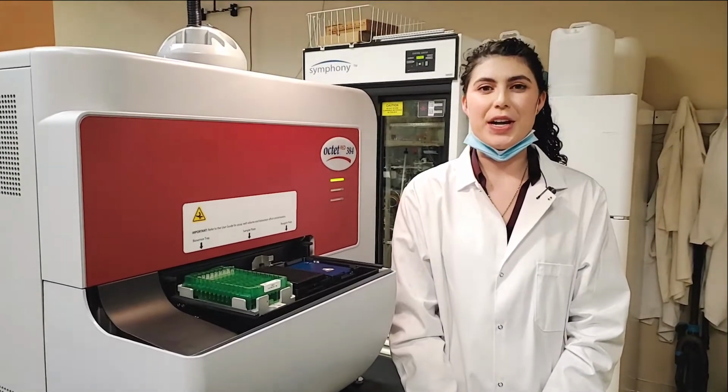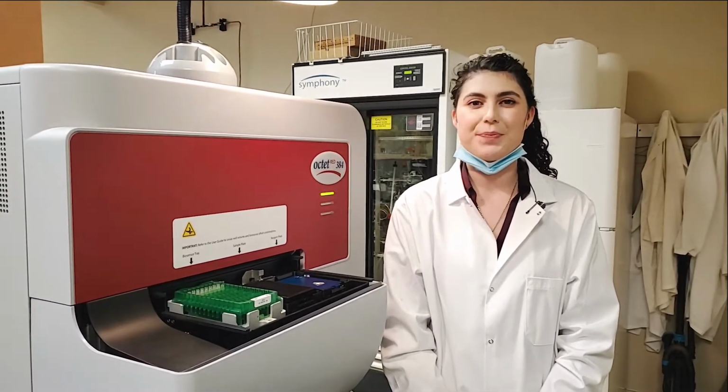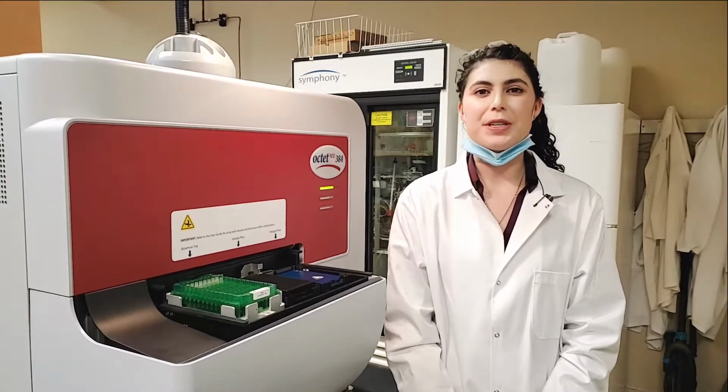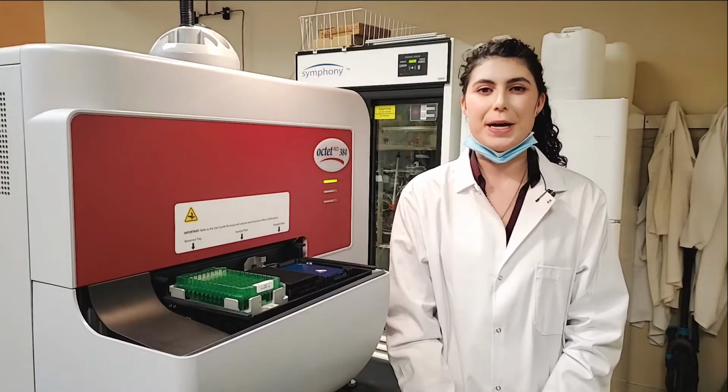My name is Paige LaMore, and I'm a graduate student in the lab of Dr. Rob Woods here at the University of Georgia. I'm involved in GlycoMIP projects that utilize an optical analytical technique called biolayer interferometry, or BLI.